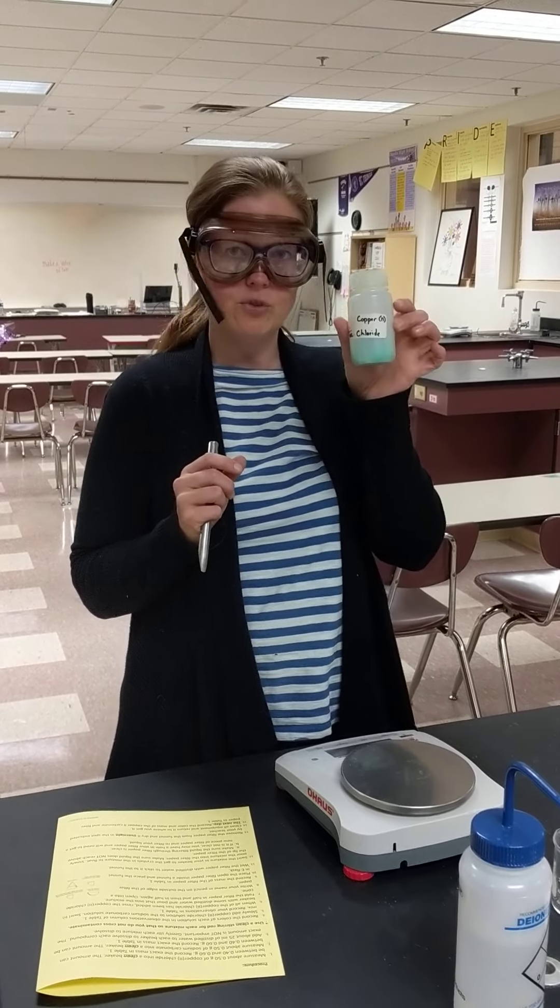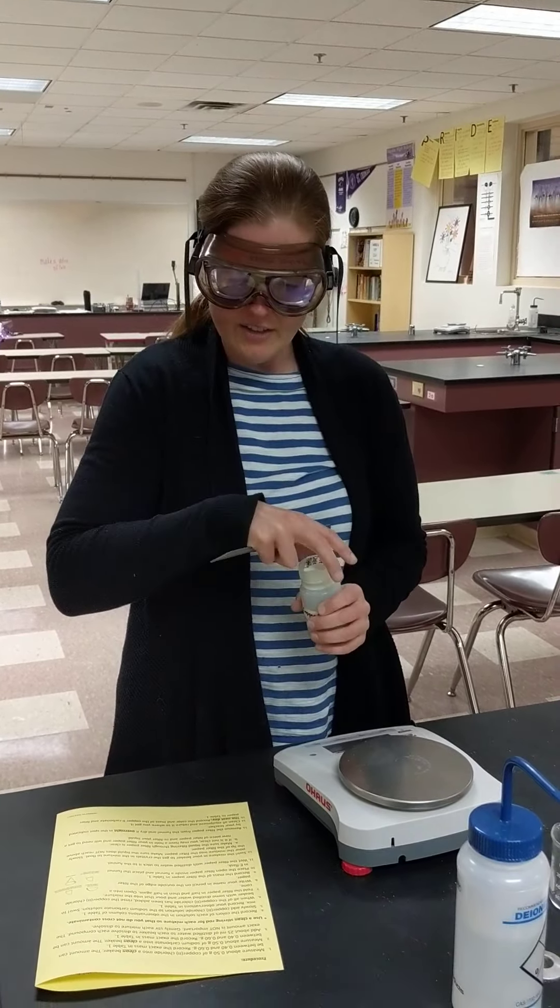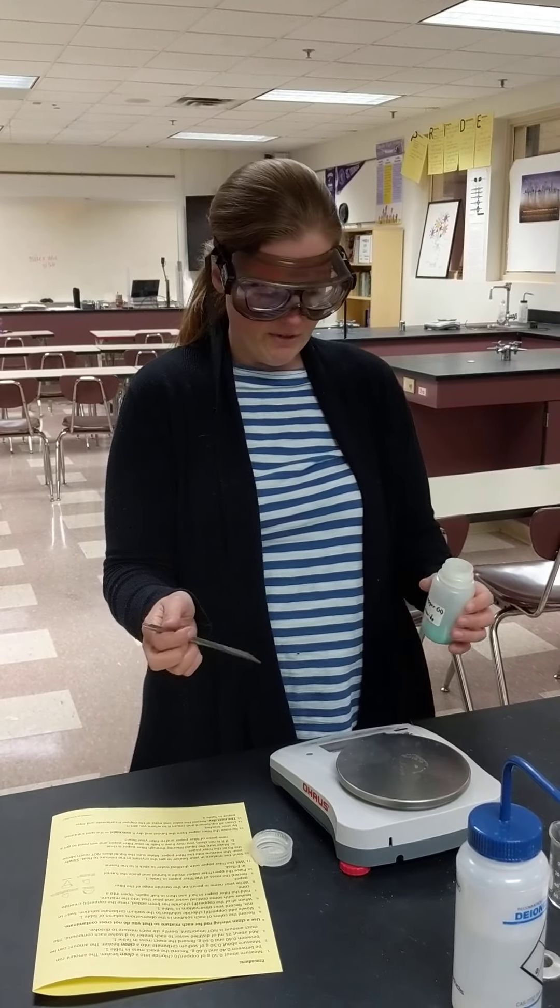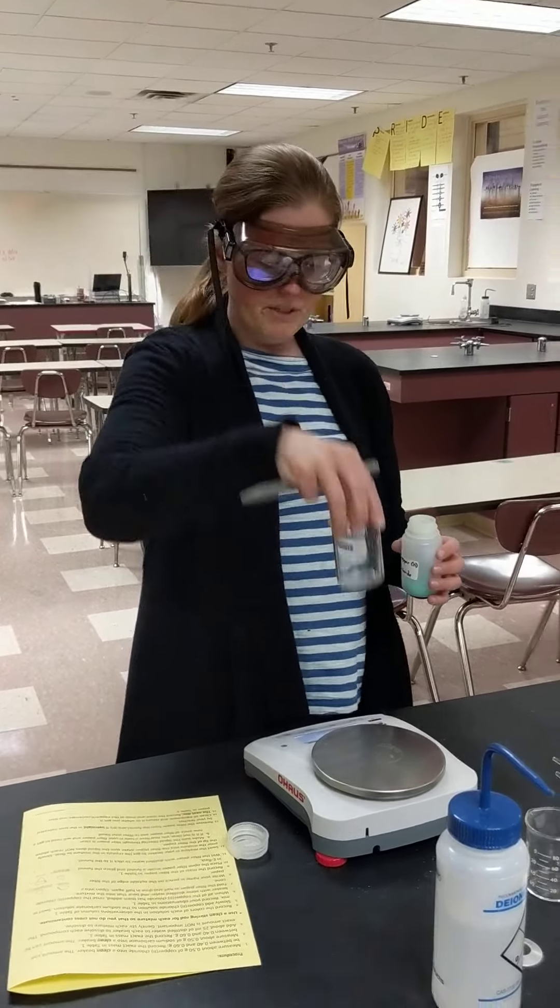We're going to first take copper(II) chloride and we're going to take about 0.5 grams of it using a beaker.